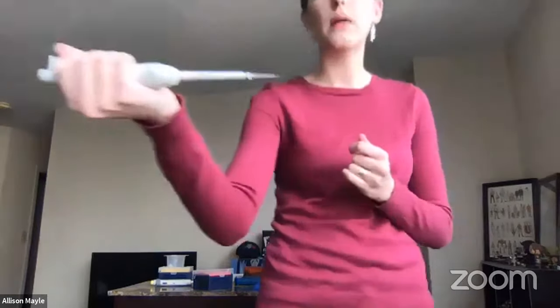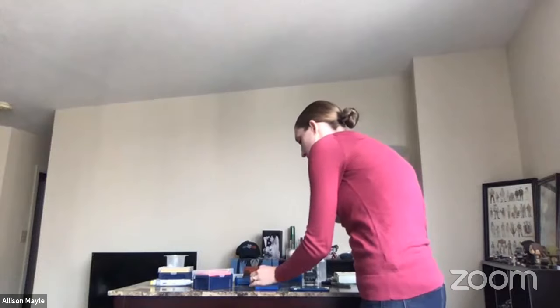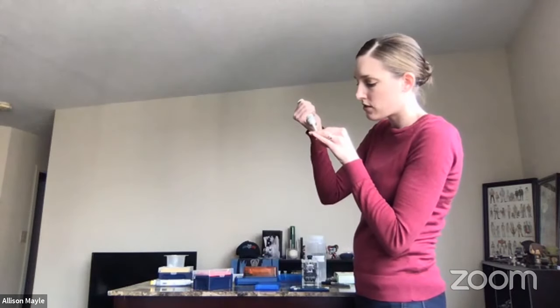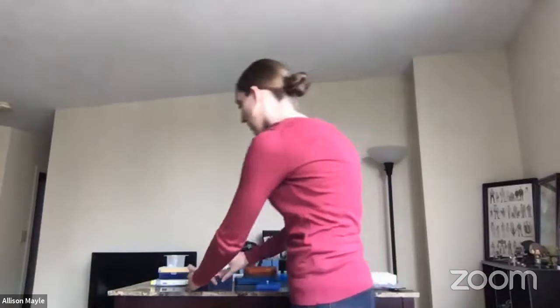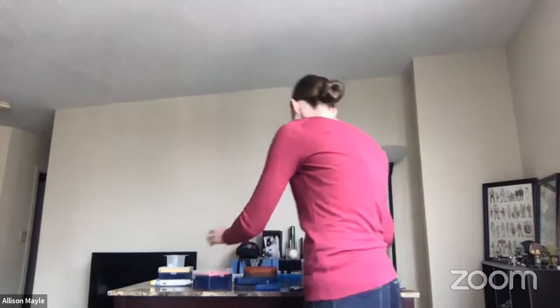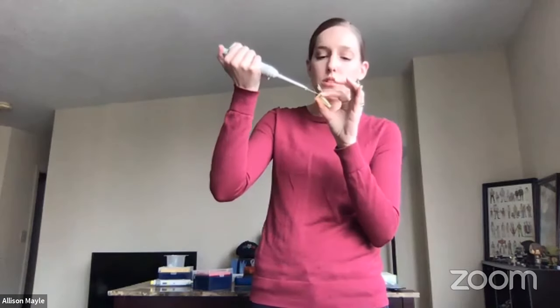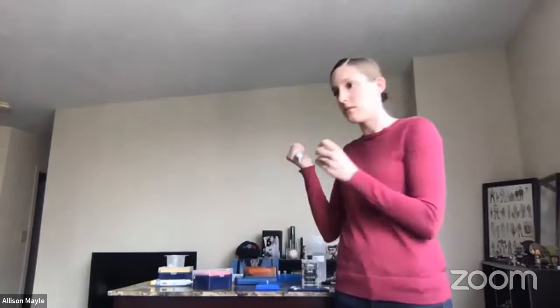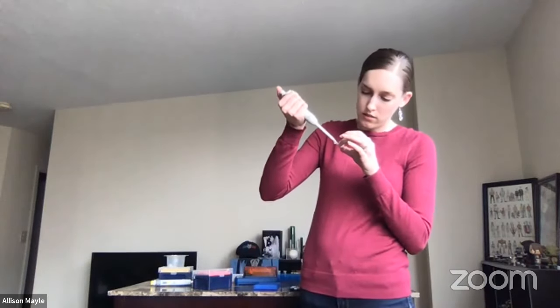I always tell my students: make sure you can visually see that you have two microliters of DNA in your pipette tip. It's not very much, but it's enough that you should be able to see it. If you look at the end of the pipette, you should be able to see two microliters of liquid. I'm going to add my plant DNA into my plant tube, right into the primer and bead mix, pressing all the way down to the second step, which lets out a little extra air and helps make sure all the DNA comes out of the pipette tip. Now I'm going to do the same thing for my invertebrate sample.